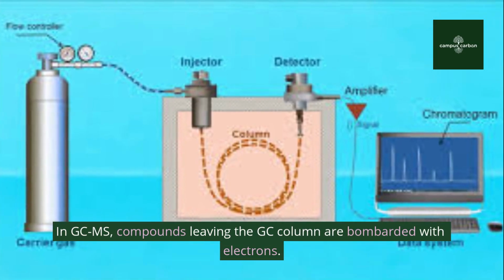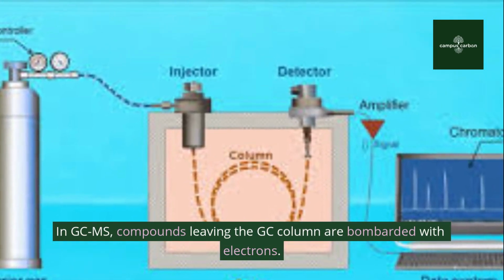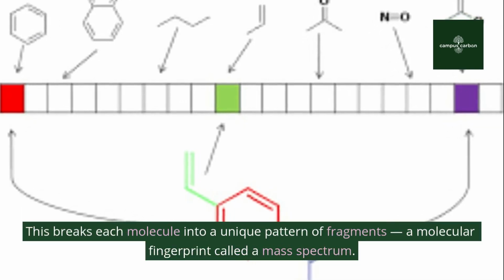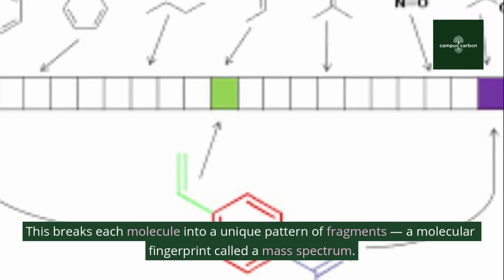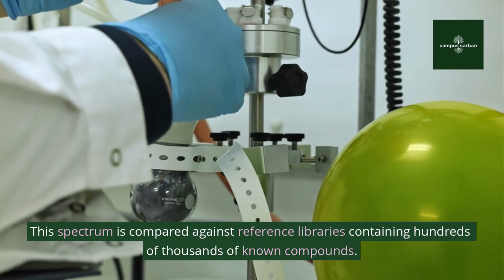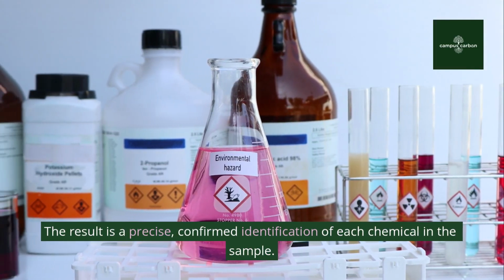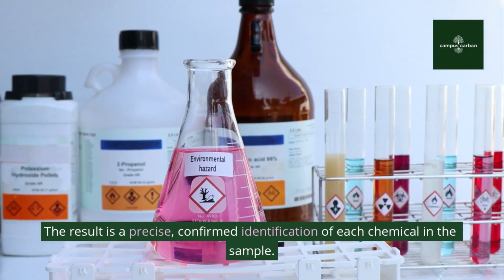In GC-MS, compounds leaving the GC column are bombarded with electrons. This breaks each molecule into a unique pattern of fragments, a molecular fingerprint called a mass spectrum. This spectrum is compared against reference libraries containing hundreds of thousands of known compounds. The result is a precise, confirmed identification of each chemical in the sample.